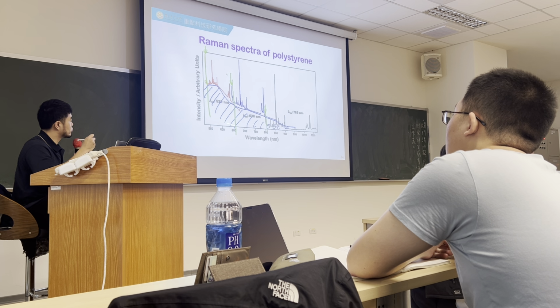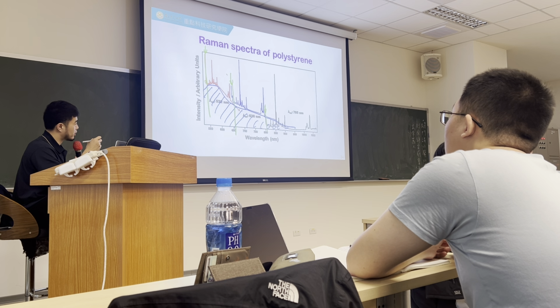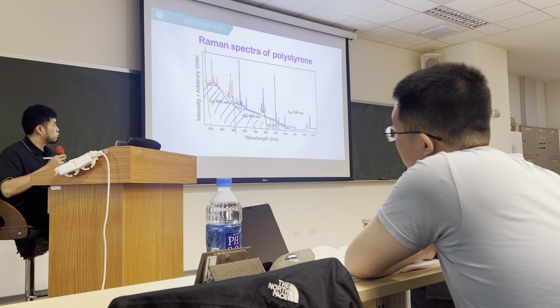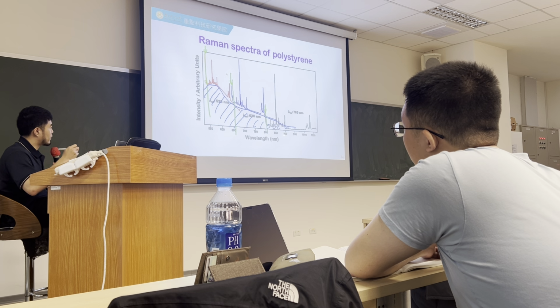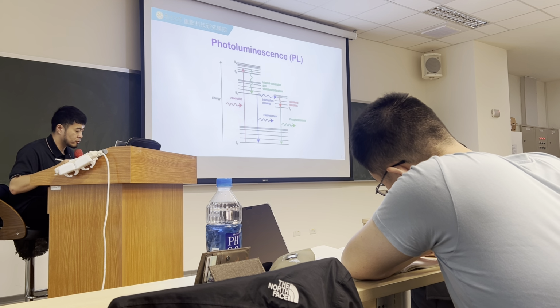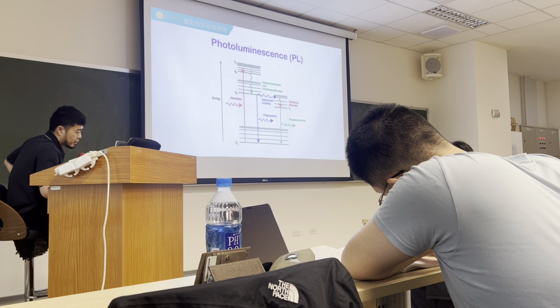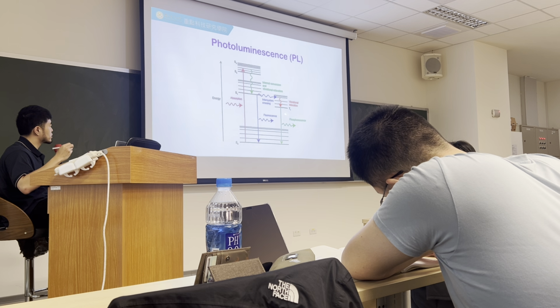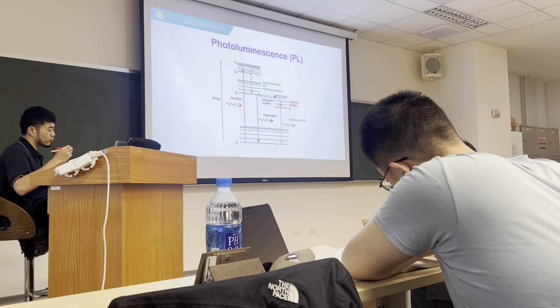So based on those results, whenever you are analyzing polystyrene, this kind of polymer, the best way is to use a longer wavelength laser. But what is that background? That's the fluorescence. Okay, so what is that fluorescence? Photoluminescence. Actually, that background is coming from the fluorescence.